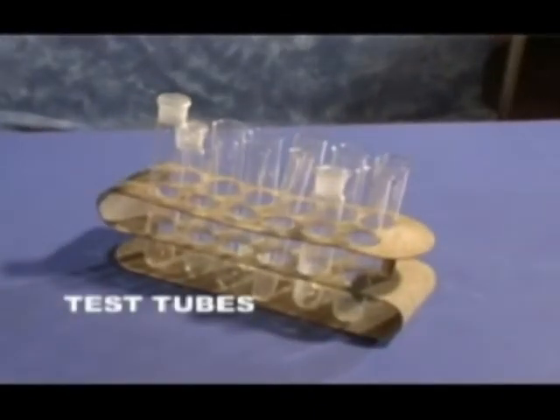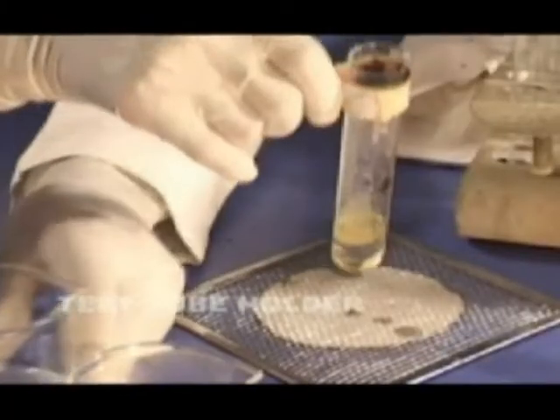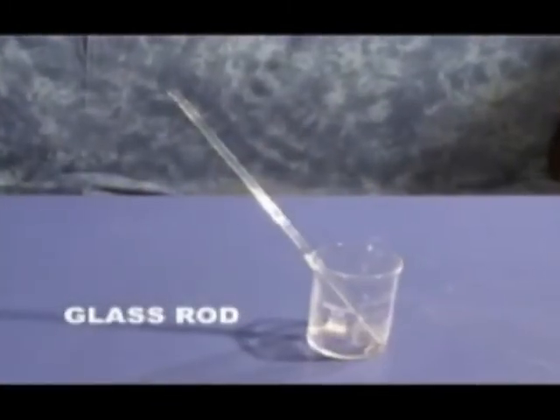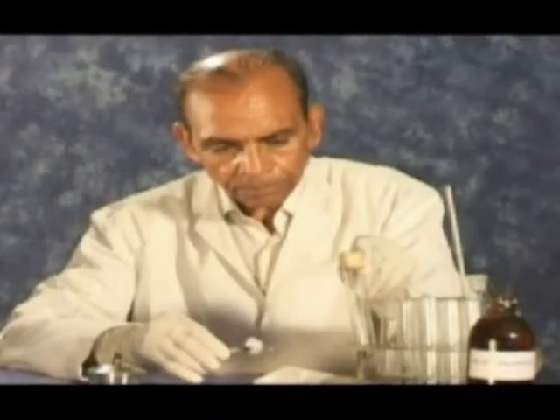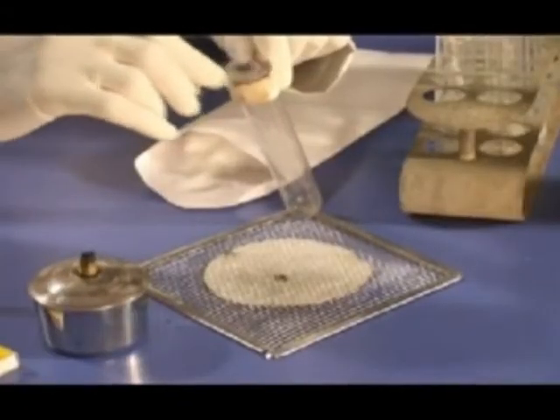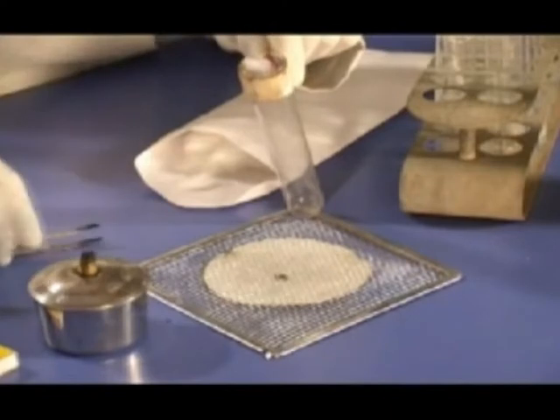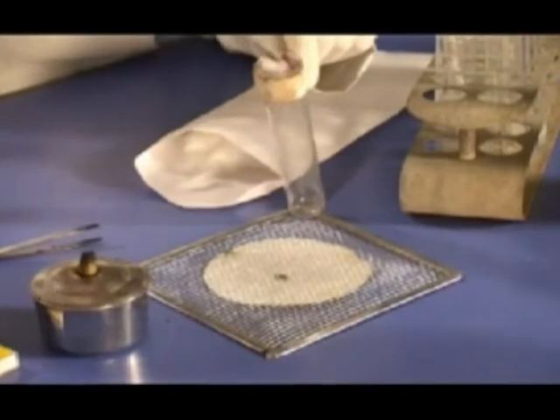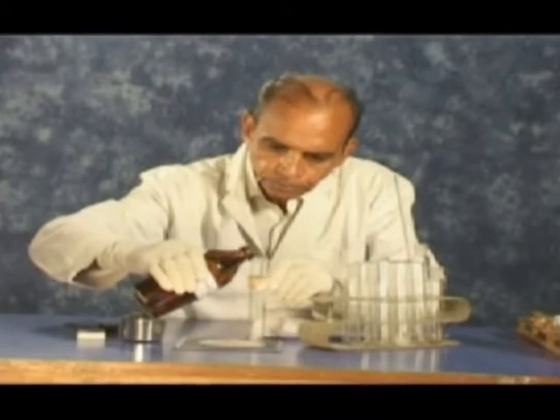Now, here are a few steps which will help you to identify the fibers. Step 1: Treat the fiber sample with 0.25% to 0.50% sodium hypochlorite solution. If soluble, they may be wool or silk. If the fiber is insoluble in sodium hypochlorite, go to Step 2.